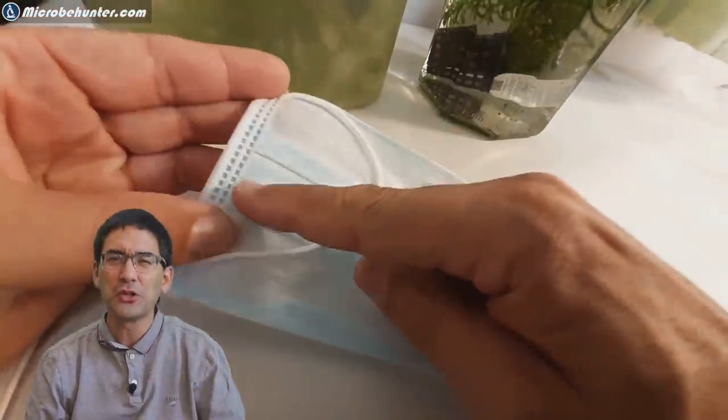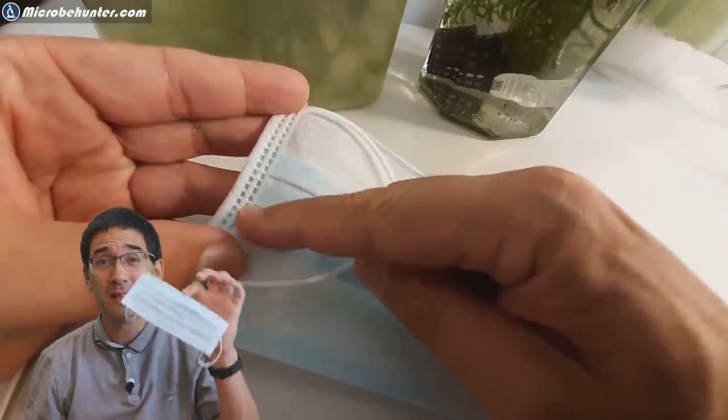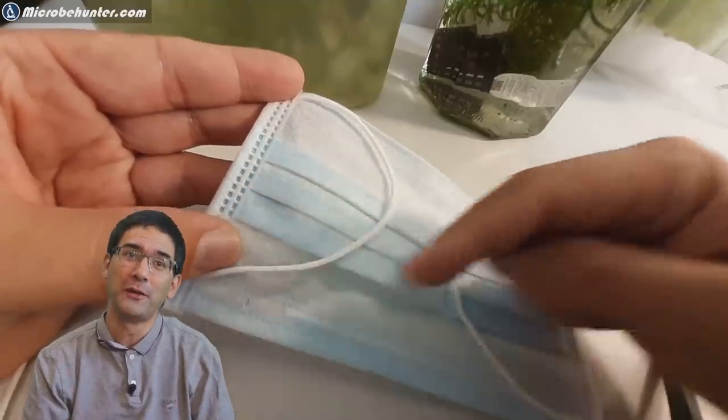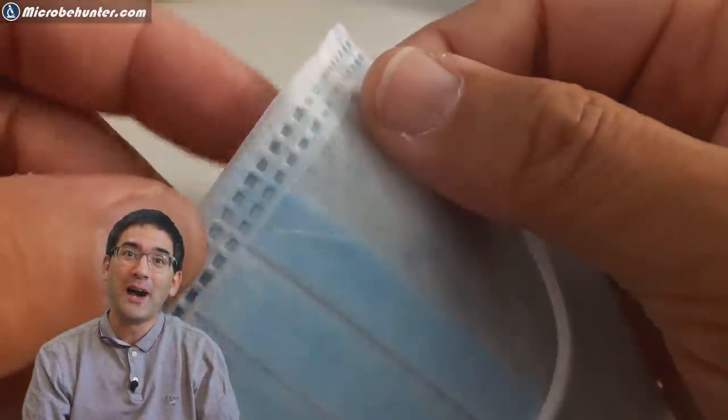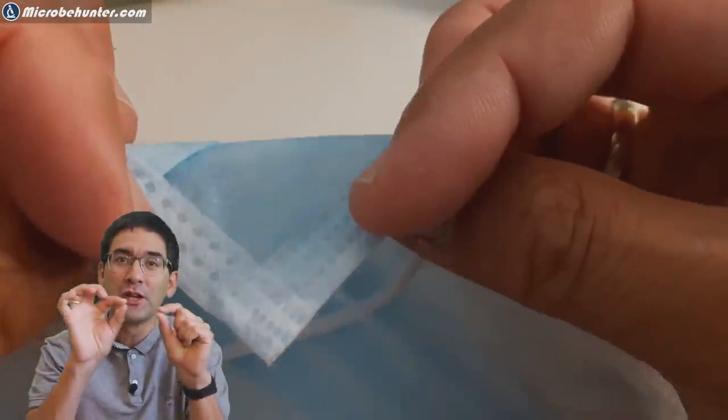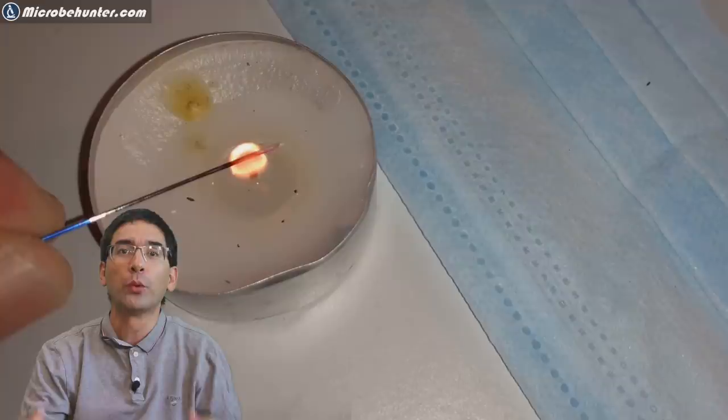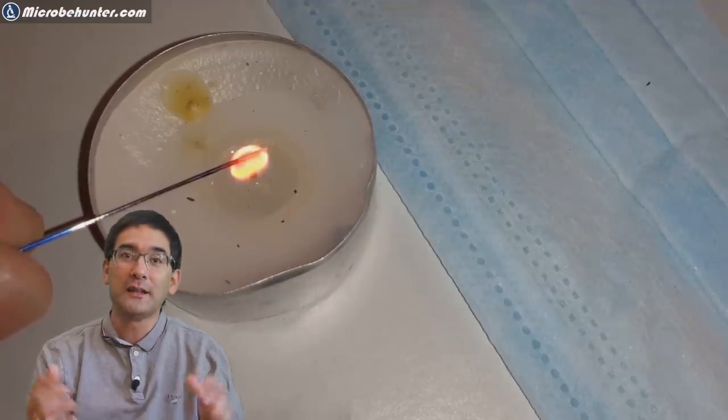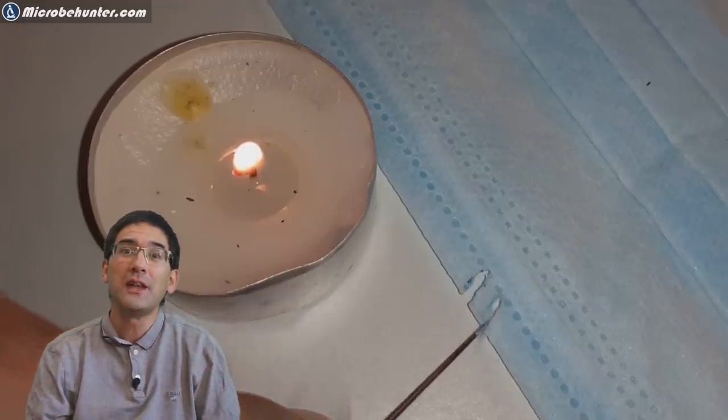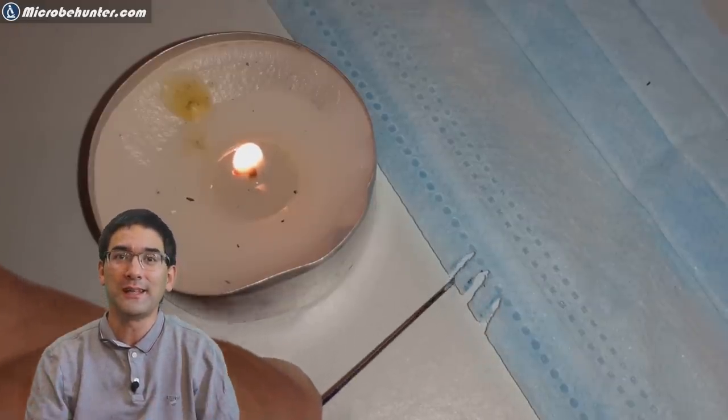Namely that it's not made of cotton. In this video I'm going to show you how I actually found that out. One way was by seeing those regular patterns where the different layers were fused together. To really check whether it's made of cotton or some artificial fibers, I used the so-called needle test.